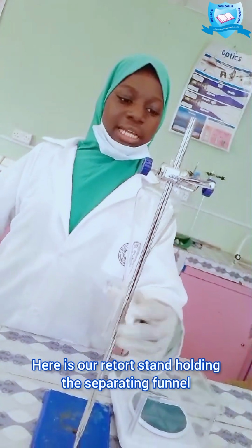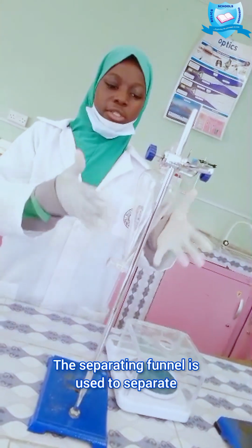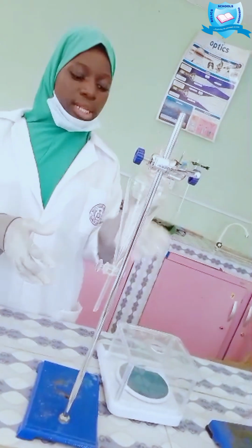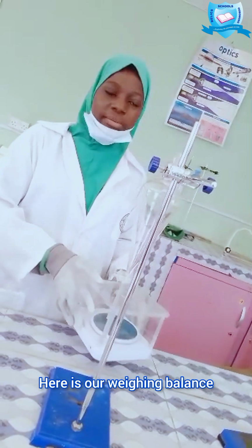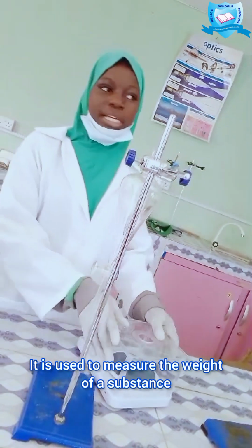Here is our retort stand holding the separating funnel. The separating funnel is used to separate immiscible liquids, for example, water and kerosene. Here is our weighing balance. It is used to measure the weight of a substance.